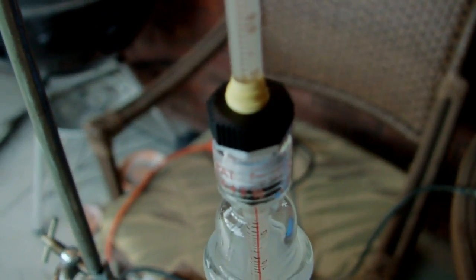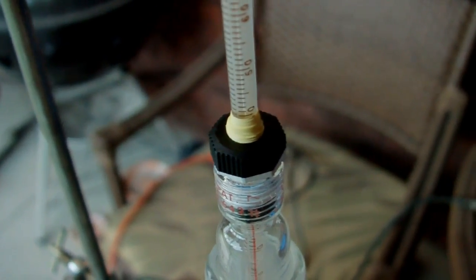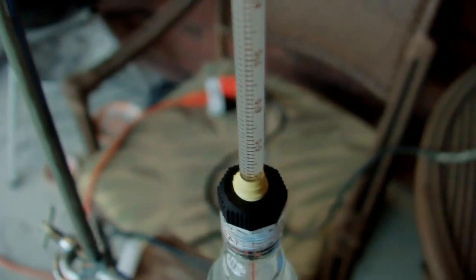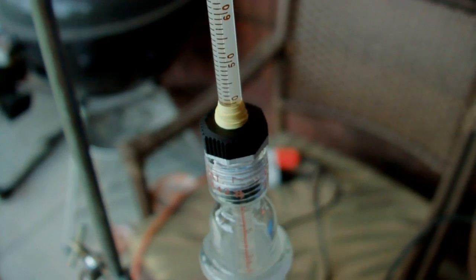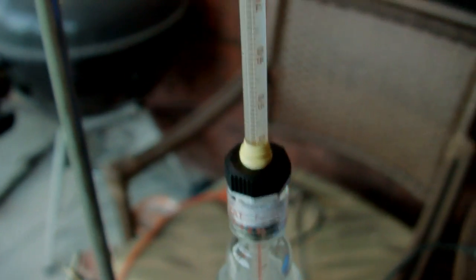And of course I put the thermometer in at just the right depth where the temperature I want to see is covered. It's actually in the adapter. But if you kind of look down into it, it looks like the temperature is about 35-ish, somewhere in that range.